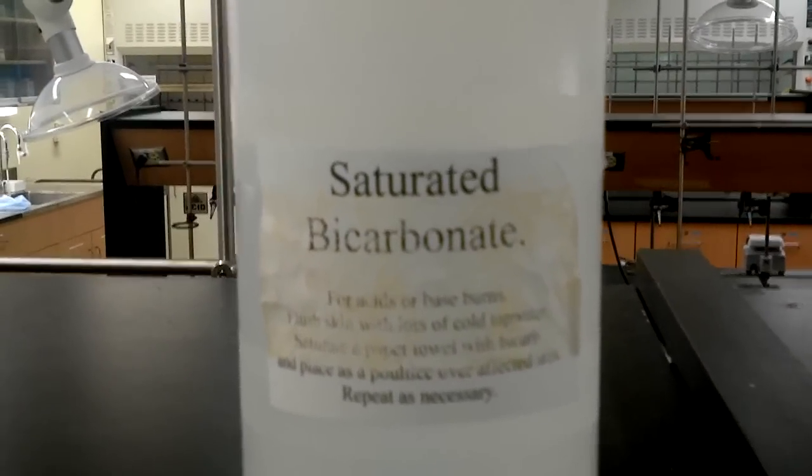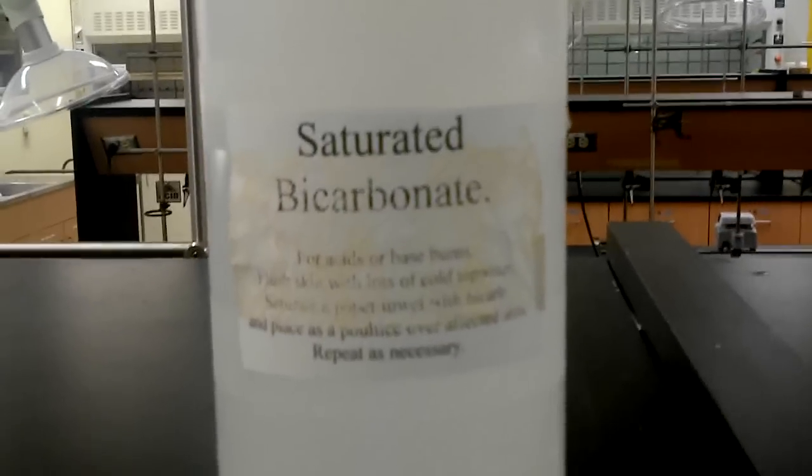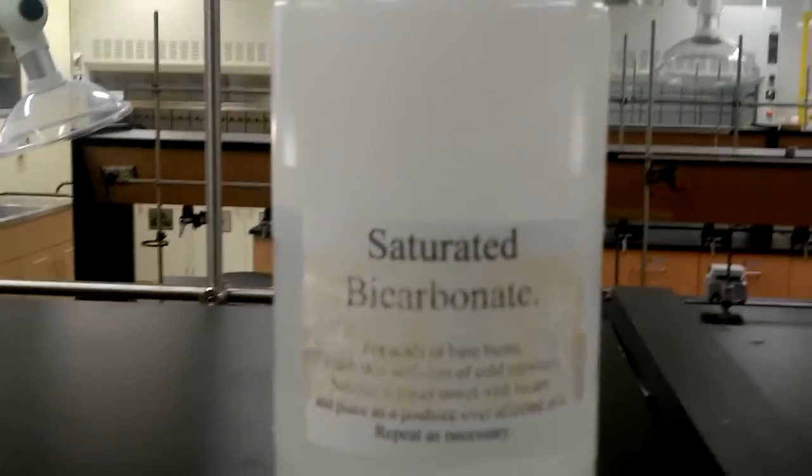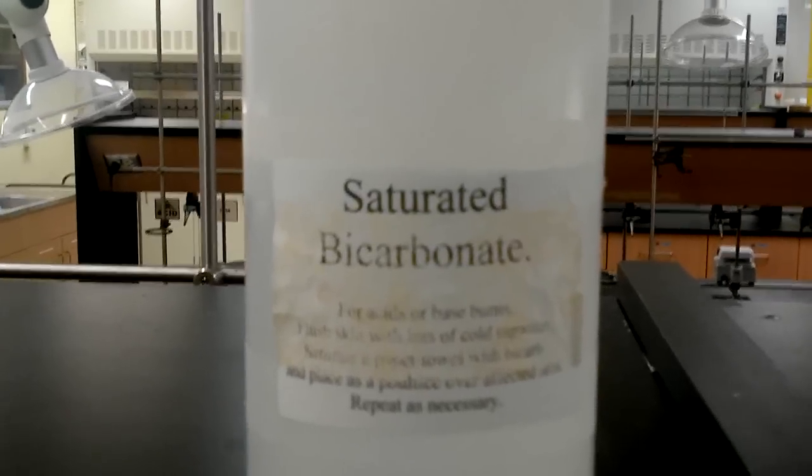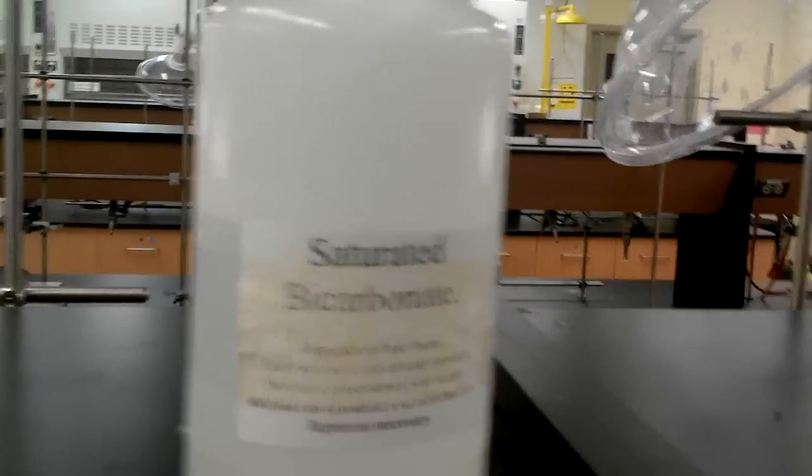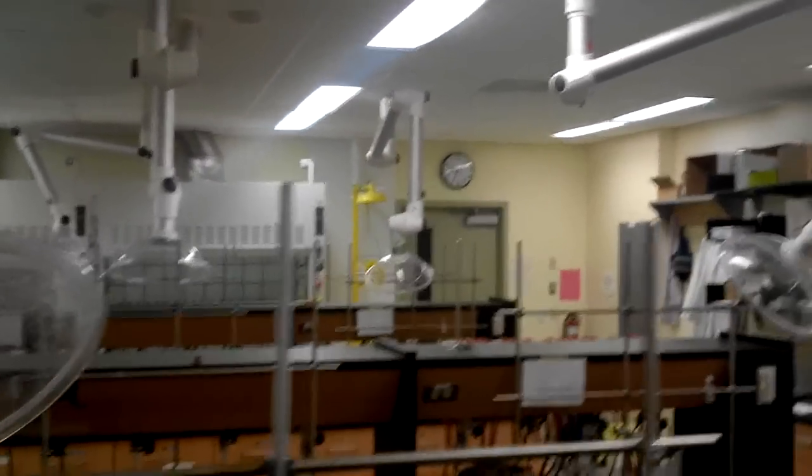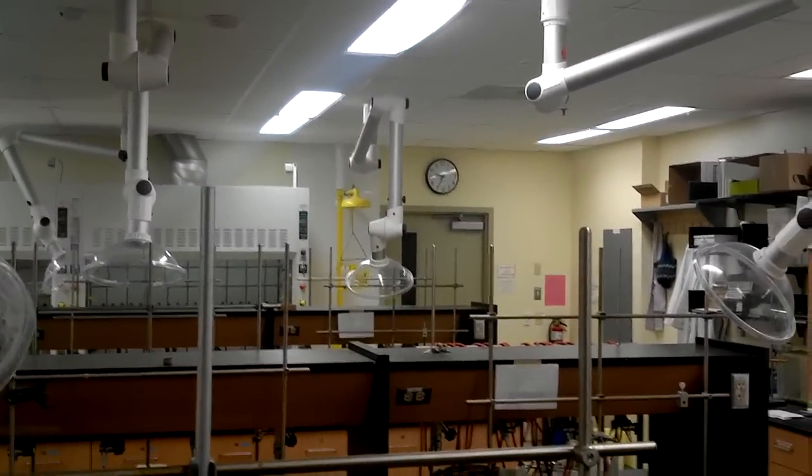Then you hold that on your acid burn. The saturated paper towel will take care of the acid burns, but it's got to be pretty severe before you do that. If you really have an acid spill all over yourself, you'll be going over there by the door and having a shower. Hope that doesn't happen.